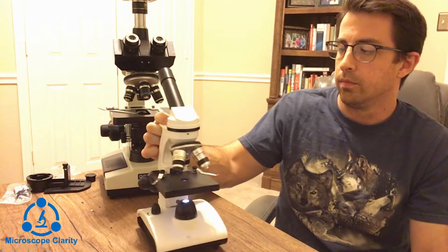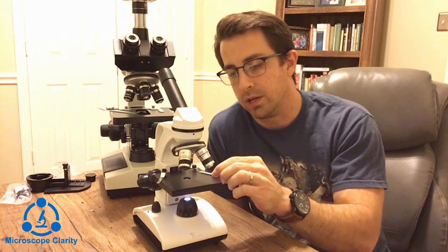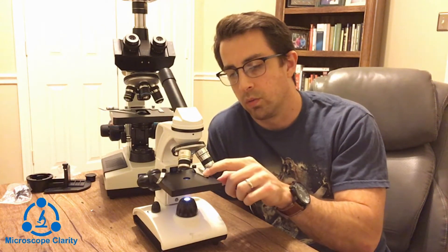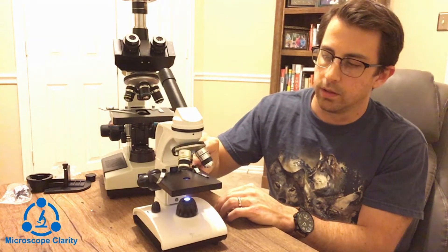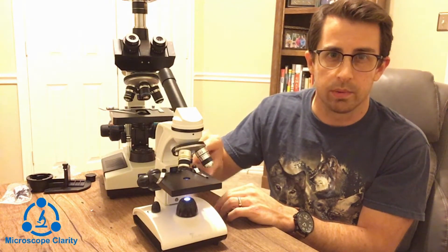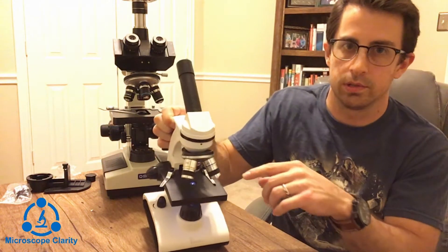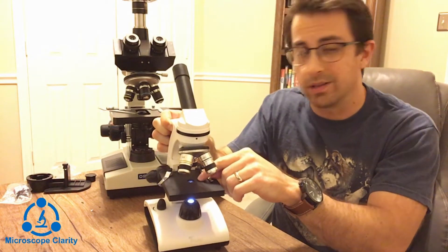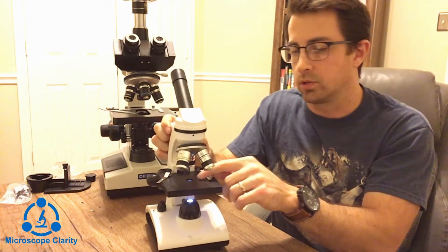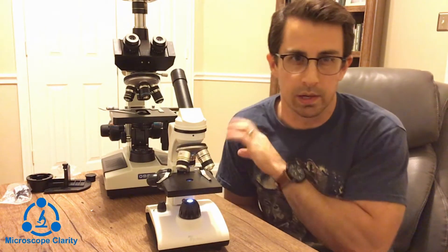We have the stage, and on the stage we've got the stage clips, which hold the slide in place. To raise them up you just lift up on the back, and you place the slide over the top of the aperture. The aperture is the hole where the light shines through. There's a condenser lens — a small single lens in this microscope; the more complex microscope has a bigger condenser which we'll look at in a second.